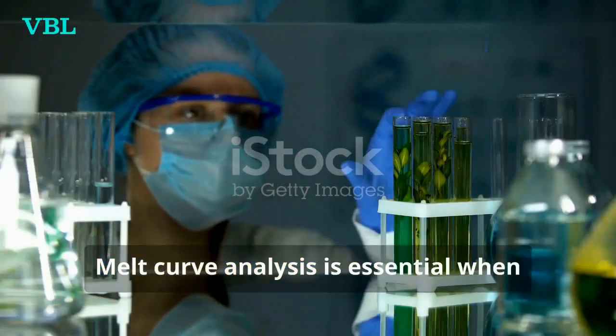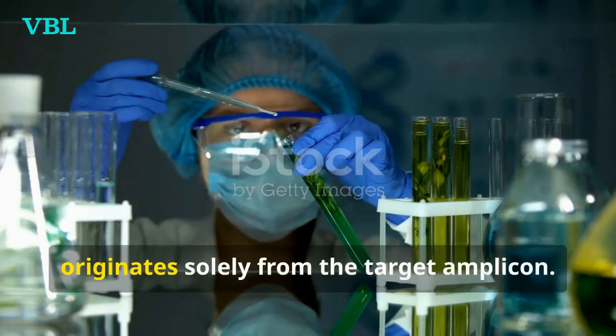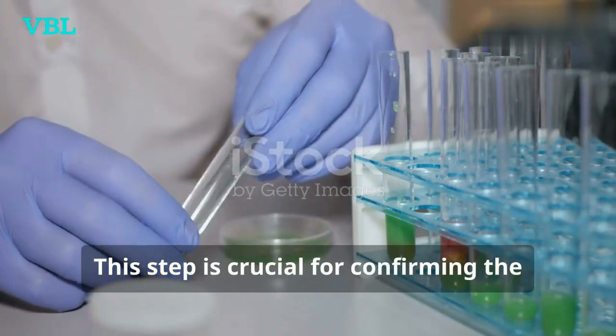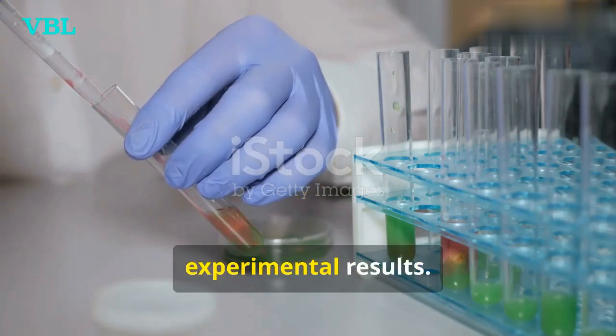Melt curve analysis is essential when using DNA binding dyes like SYBR Green to verify that the fluorescence signal originates solely from the target amplicon. This step is crucial for confirming the purity and specificity of the amplified product, ensuring the integrity of the experimental results.